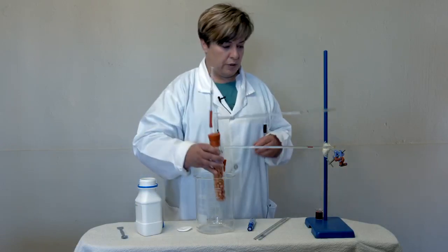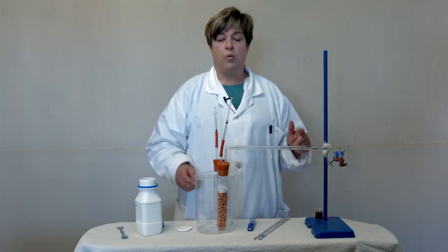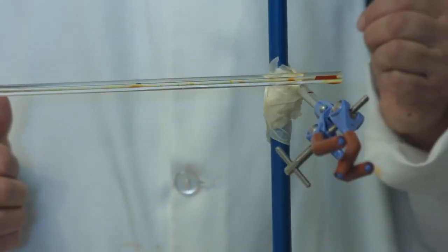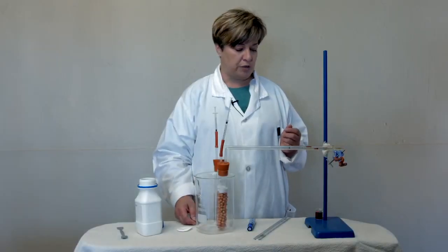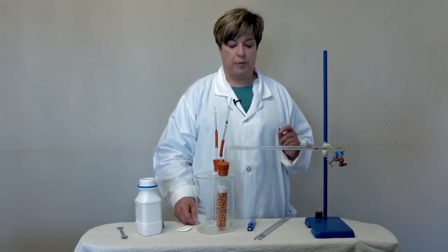This tube, that is our experimental control, we did not see any changes, which is also correct, because we don't expect any sudden changes in the temperature or in the air pressure while we are doing our experiment for such a short period of time. And therefore, we are just going to say that measurement is 0.